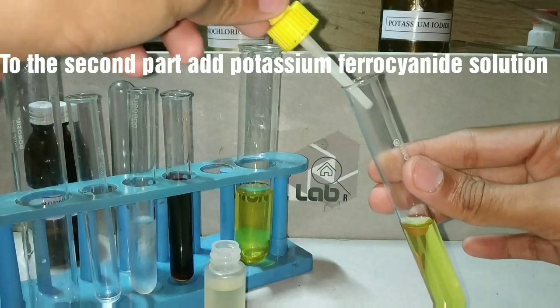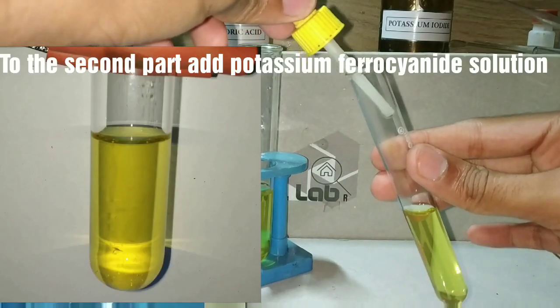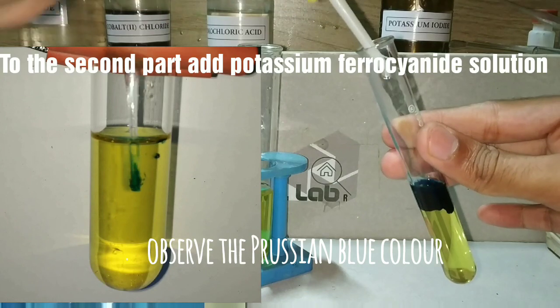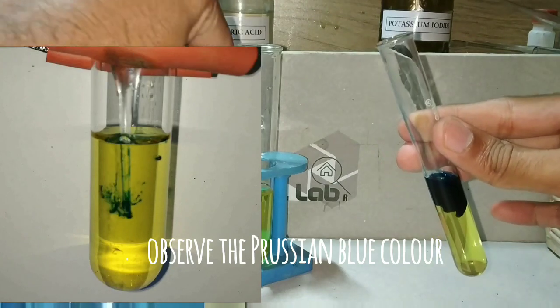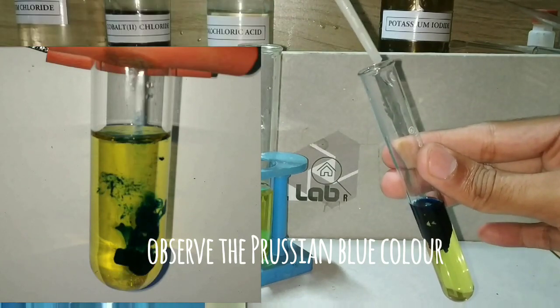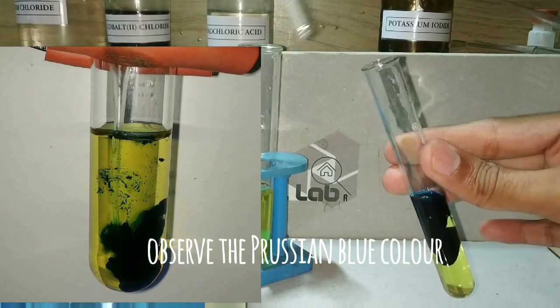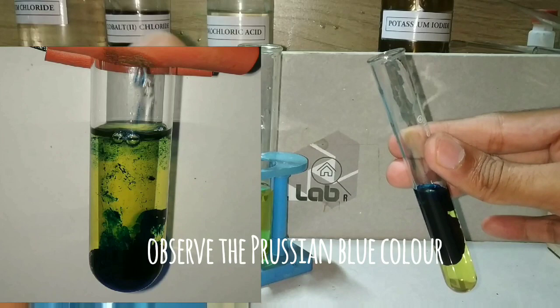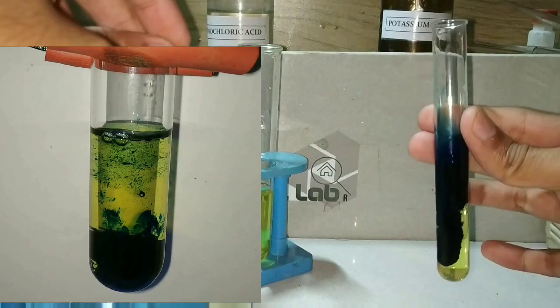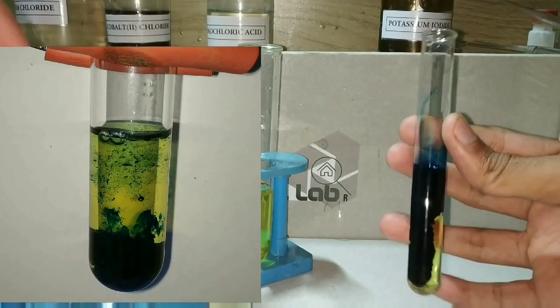To the second part of the solution I am adding potassium ferrocyanide. You can observe the formation of a Prussian blue colored precipitate, or rather a colloidal solution.